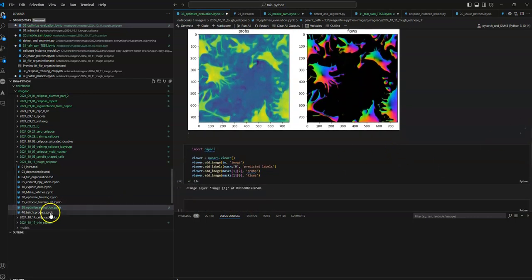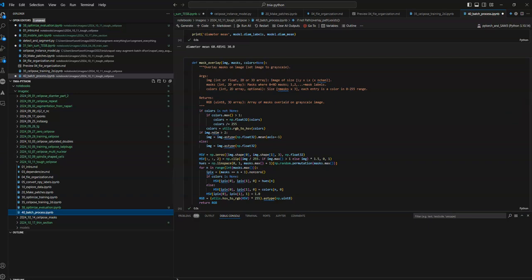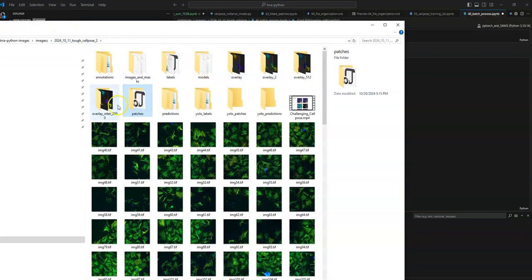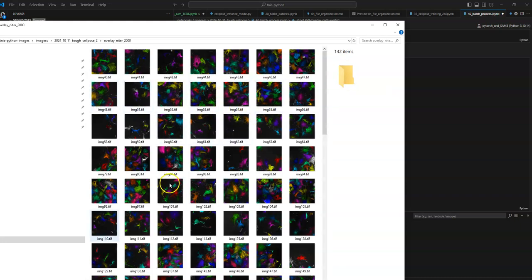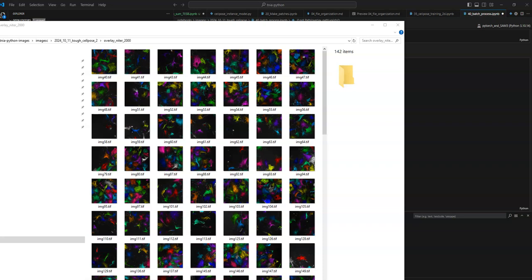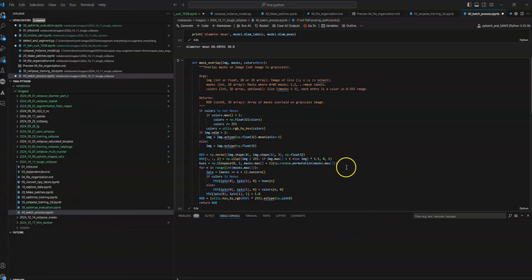And then other than that, this last one is also a batch process notebook, which is kind of useful because, if we look here, it generates a bunch of overlays. So you have all these images with overlays to quickly present to other people. So that's it for the notebooks for this problem. I plan on discussing this problem further in the next weeks, and it should be interesting to see what strategies there are to make this even better.